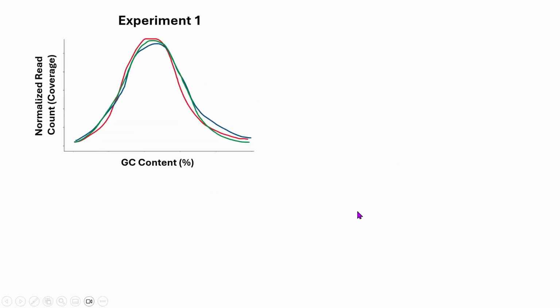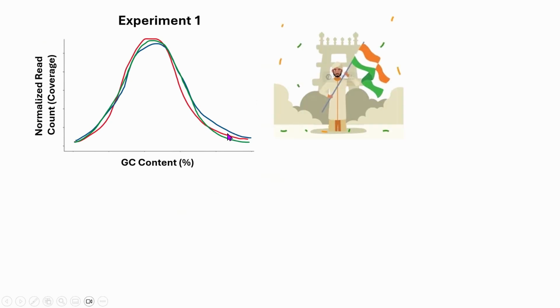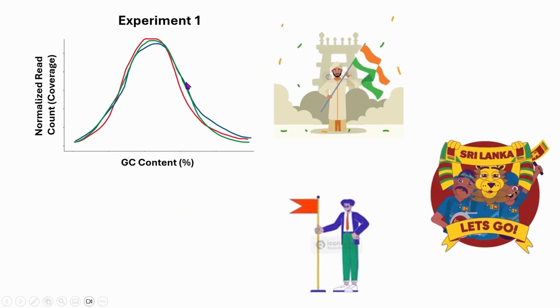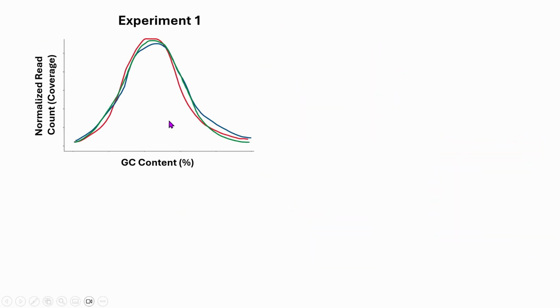Next, we are going to see how GC bias varies from sample to sample and from experiment to experiment. Suppose we have three healthy samples with very similar biological properties. Maybe they are all Indian people or Sri Lankan people, or maybe they are all American white people, and they are all healthy. We do sequencing on them and construct all three of their GC bias curves. You will see that in the same lab, if it is done at the same time, the GC bias curves will be very close. There will be some difference from sample to sample, obviously, but it will be close.